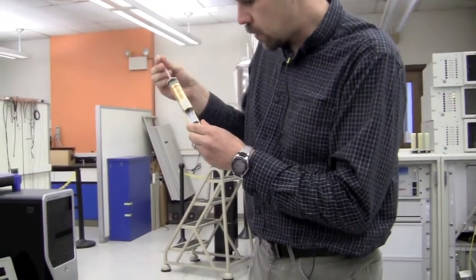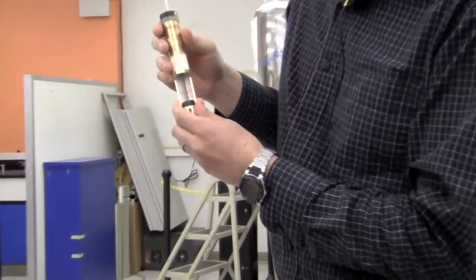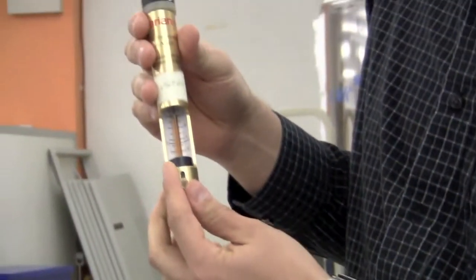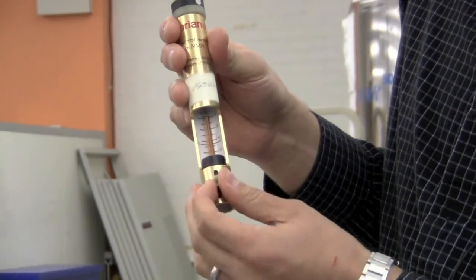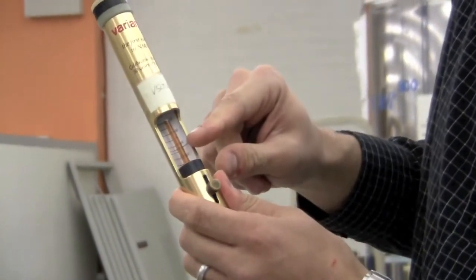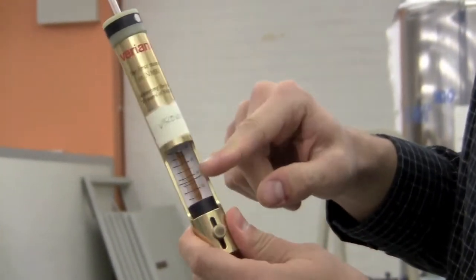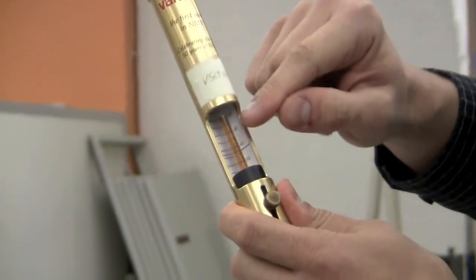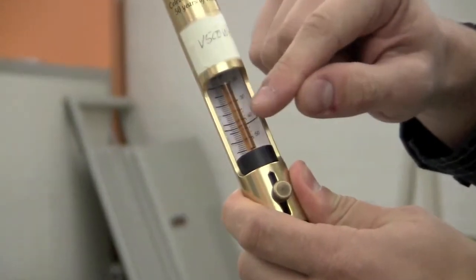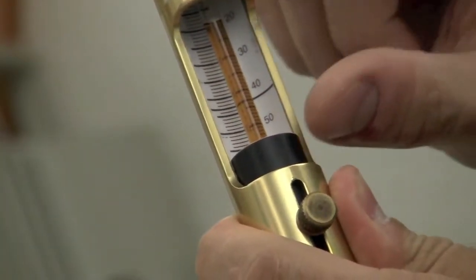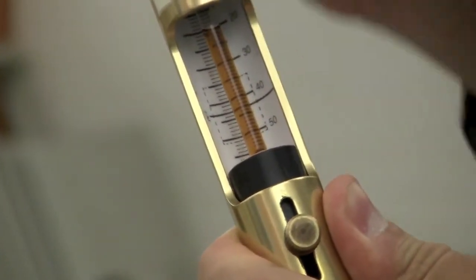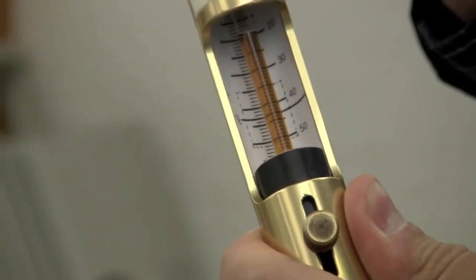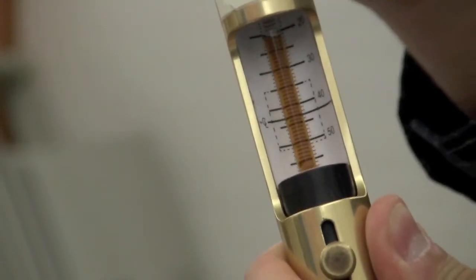Normally you can push it down to the bottom, but one thing to be aware of is that this can be adjusted here. So best is to make sure that your sample is centered on the center line and the dash box is the detection coil. You want to make sure that it's symmetrical around the detection coil. So once you set the depth correctly, you can put the sample back into the magnet.